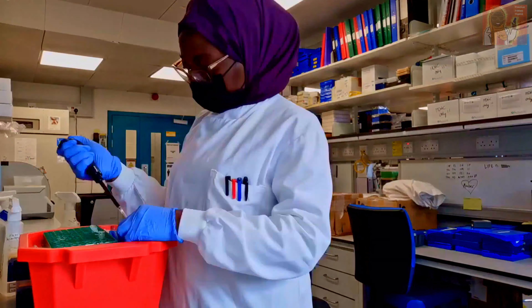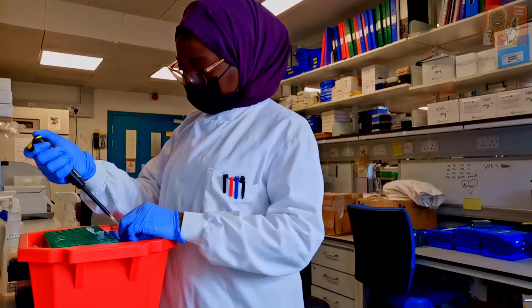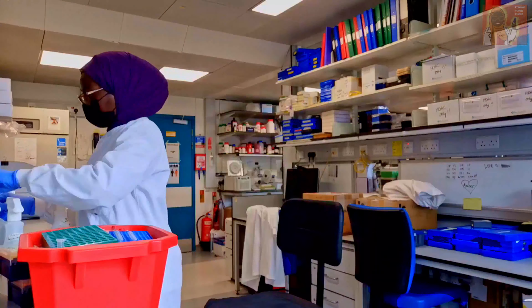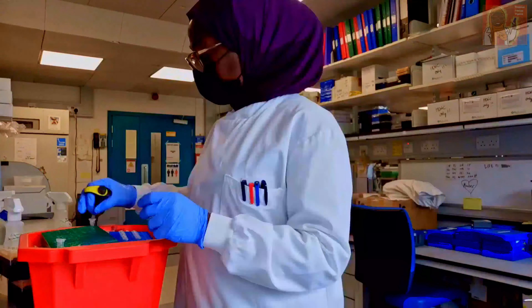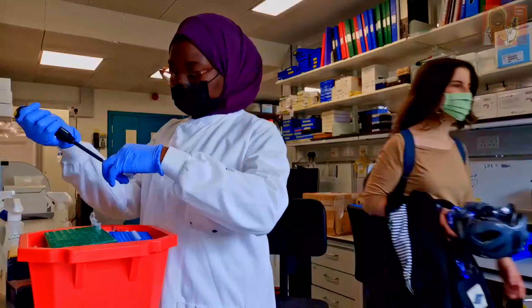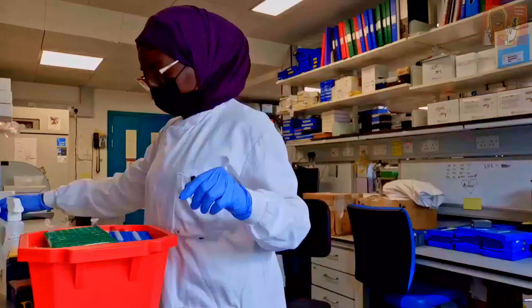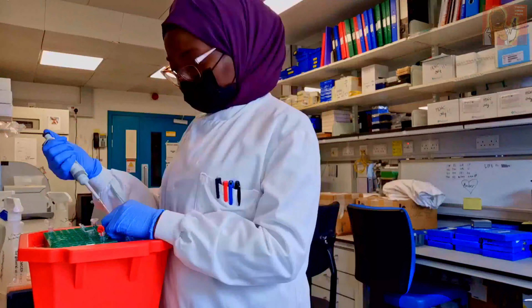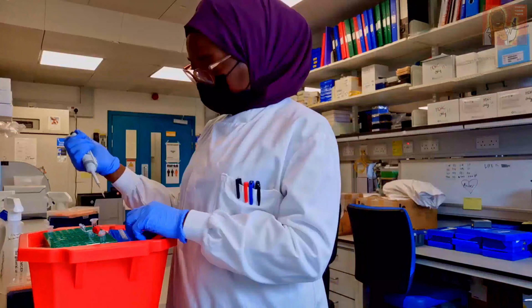This is the normal process I showed you guys earlier in my 18th vlog — here is me just pipetting my samples into the tubes and preparing the DNA samples so that I can make libraries from them.